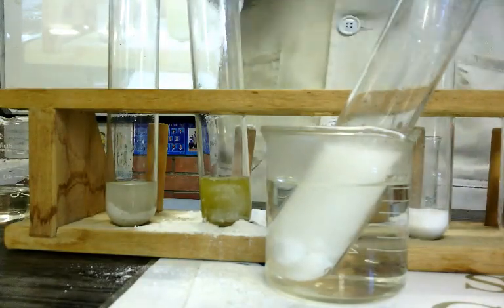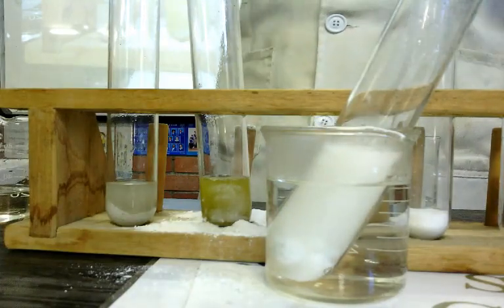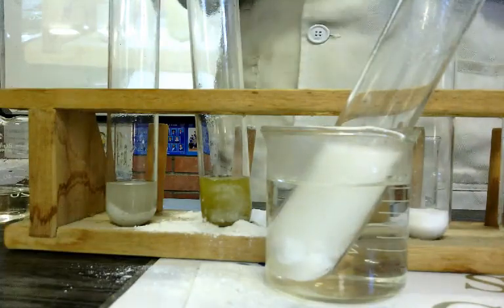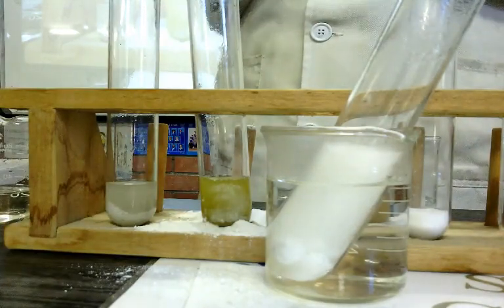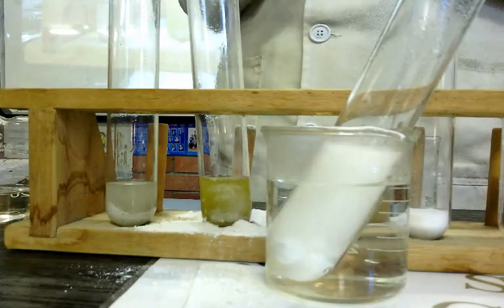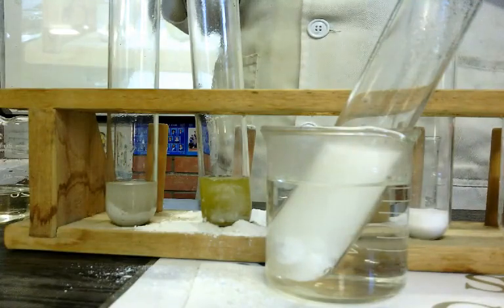So the acid now, with a low concentration, is warming up. So now the particles have higher kinetic energy. The temperature of the particles can be the next factor. Yes, the third factor is the temperature of the particles. So it's concentration, state of division, and temperature.